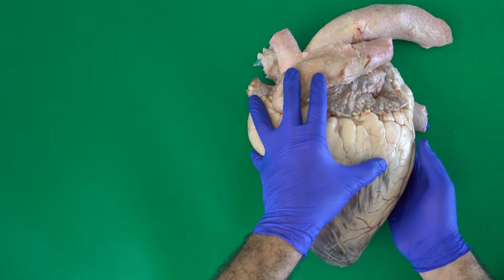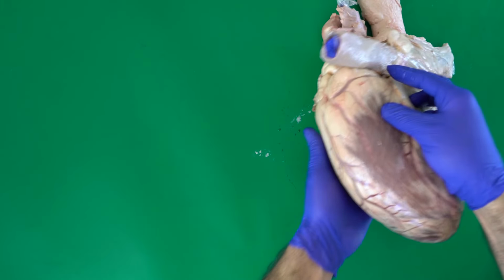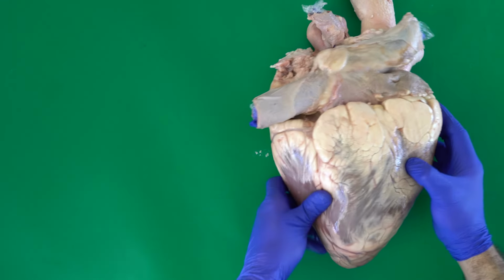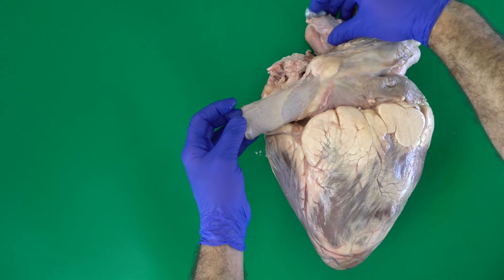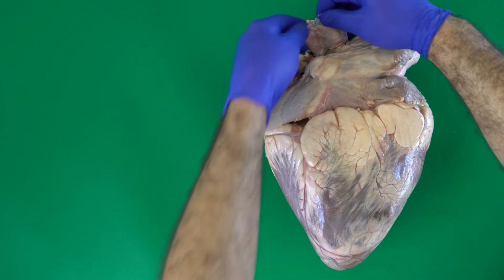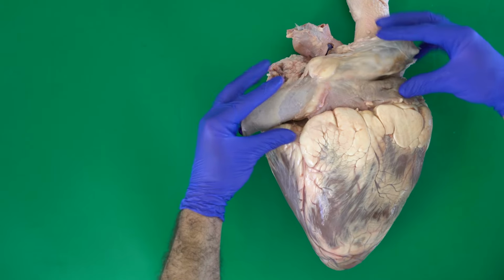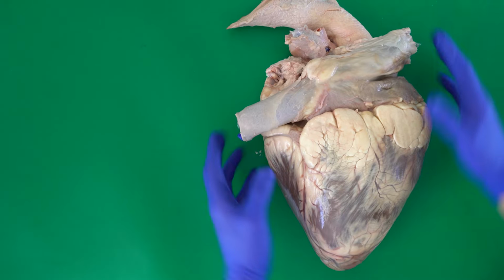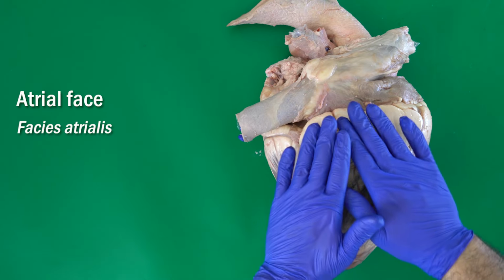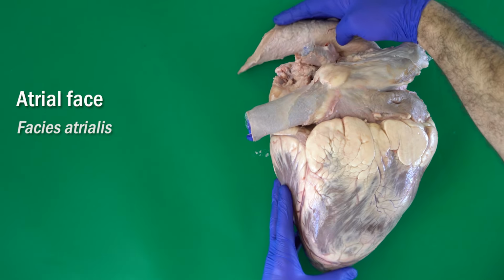Now we will move to the right side. So let's just rotate the heart like this. Yes, as you can see, we put something inside the veins and inside the arteries to fill them and make them a little bit hard, to let you know exactly the position of these arteries and veins. So this is the right face of the heart. Let's just put it this way here.